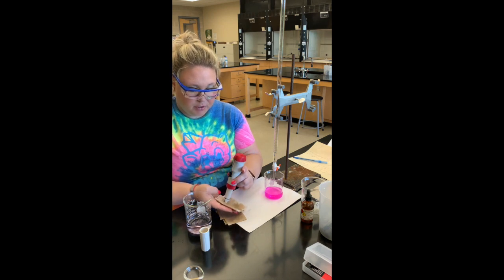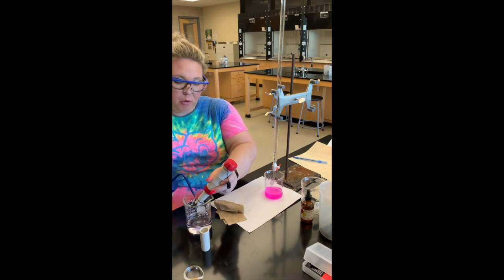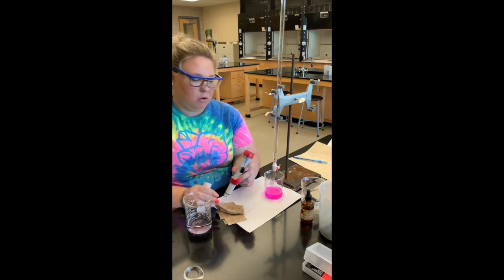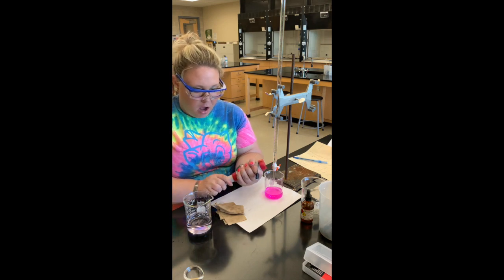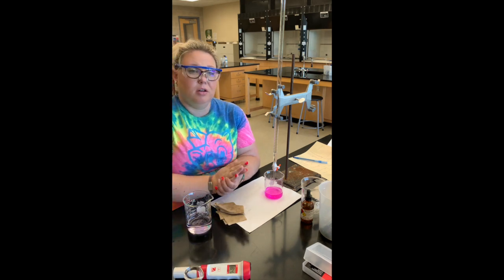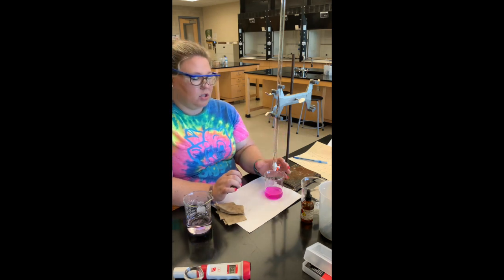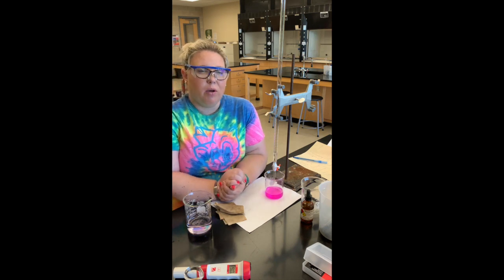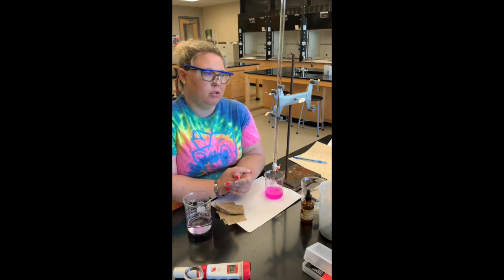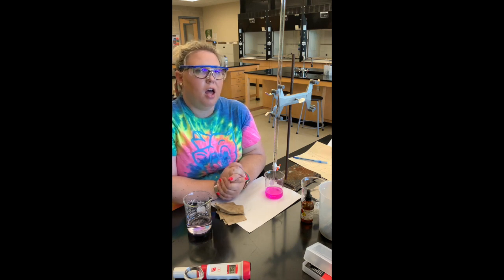Now that we're finished with the procedure for Part C, Part D is just calculations — no more procedure. I'm going to put all my waste in a waste container. Most of it is basic and pink, so I'll neutralize it with acid first. To clean the burette, drain the remaining sodium hydroxide, rinse it out with lots of distilled water, and put it back upside down with the stopcock open so the water can drain out.